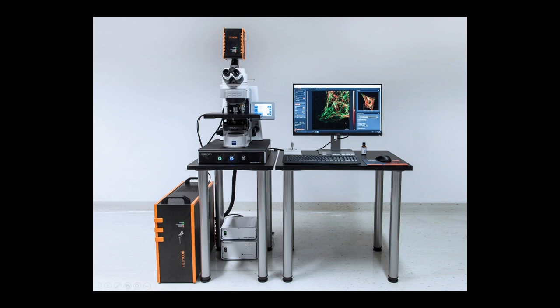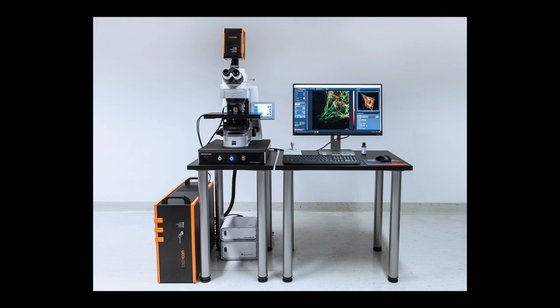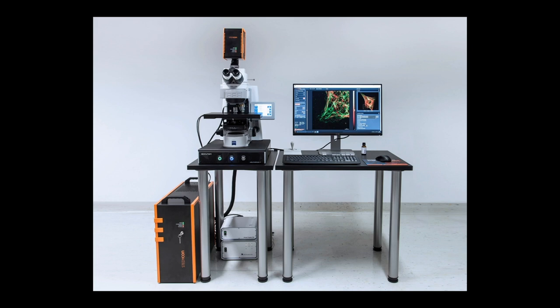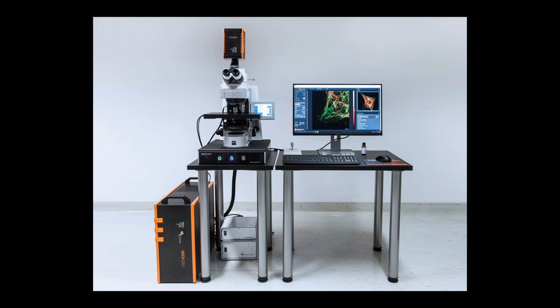In the supply unit, we have all the excitation lasers — the 640 and 560 for STED imaging, and the 488 and 405 for reference confocal imaging. Additionally we have a 775 nm STED laser inside. We can reach resolutions of about 30 nanometers in that system, depending on the optics of the microscope. All our lasers except the 405 are pulsed, so you can do pulsed excitation plus pulsed STED and also time gating afterwards. The STEDYCON has really nice and easy-to-use software, which will be shown in a few minutes.